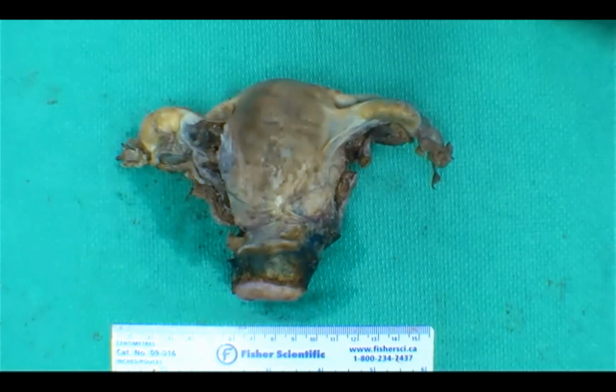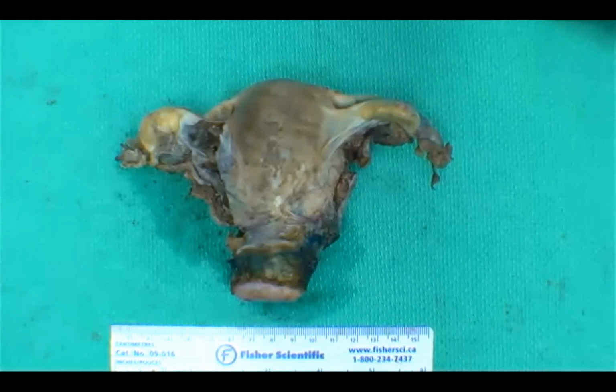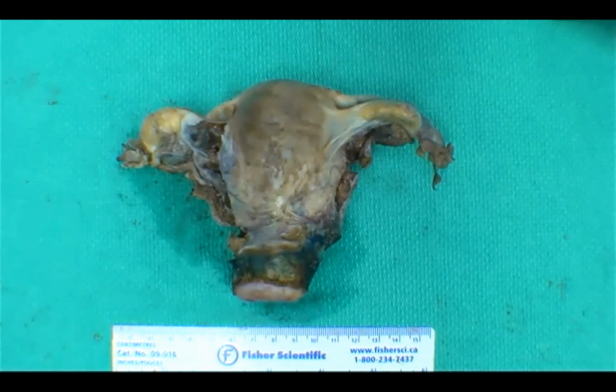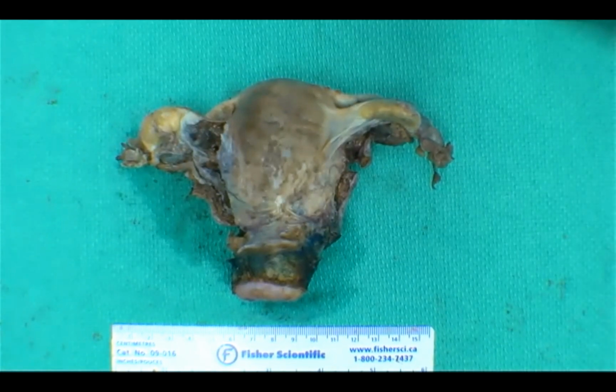Never say never, of course, and that's why we go through submitting these things under the microscopes. But just from the location of this thing and the cystic change, I think it's all in keeping with a submucosal leiomyoma. And then how does calcification and ossification grossly differ visually? Good question. I often think that calcification is more punctate, whereas ossification is a bit larger.